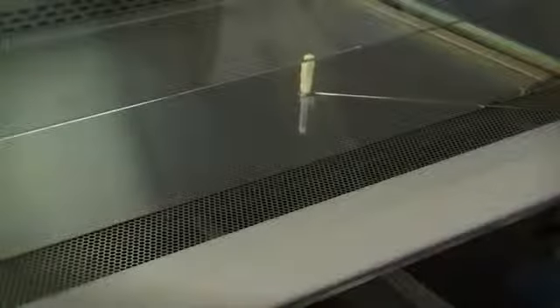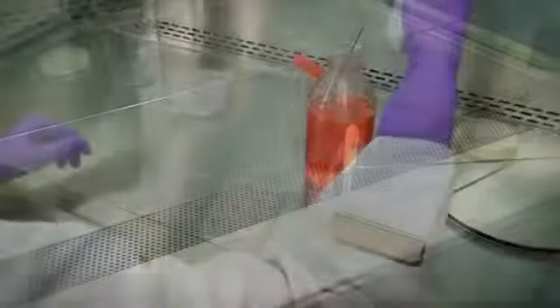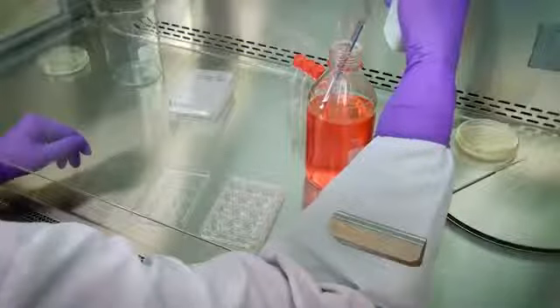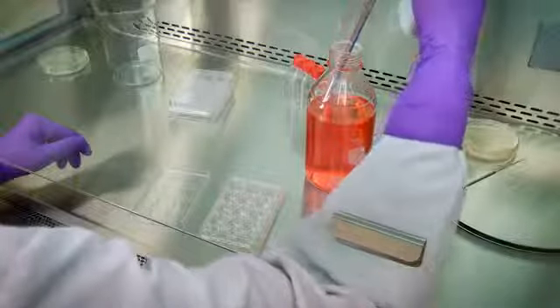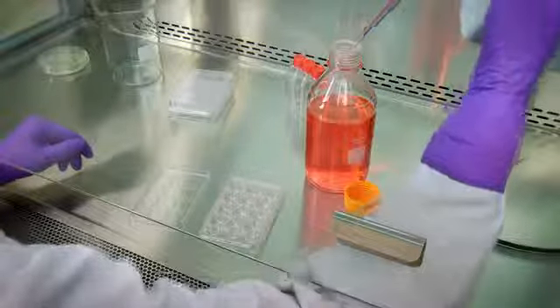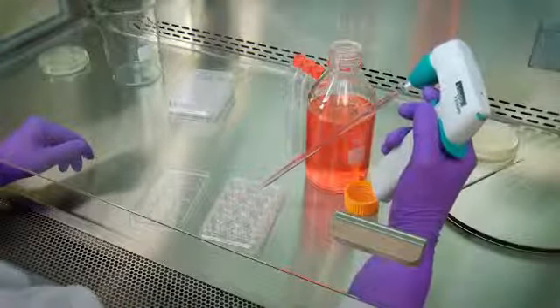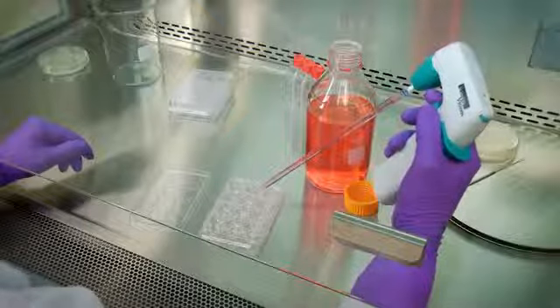Other personnel activities in the room, like opening and closing doors, may also disrupt the cabinet air barrier. Many common procedures may create splatter or aerosols. Good microbiological techniques should always be used to minimize this potential.